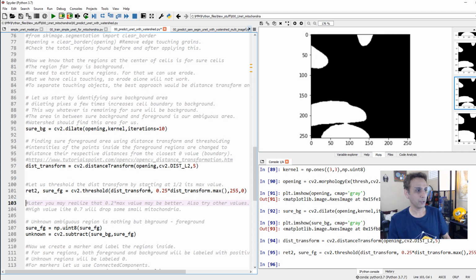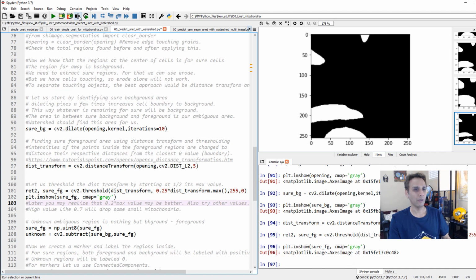And for that, I'm actually putting a threshold value of 0.25 multiplied by the maximum of my distance transform, right? So if the max here is whatever that value is, I'm doing 25% of that. This is very important. We'll see why. Because then you can get weird shapes if you don't do this in a minimal way. Okay, so let's go ahead and do sure foreground map. Okay, sure foreground. So there you go.